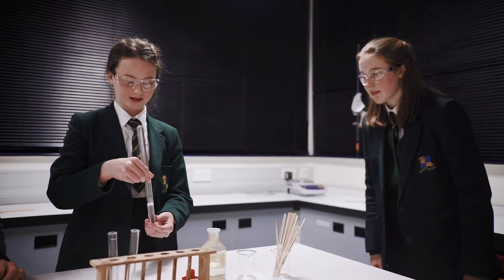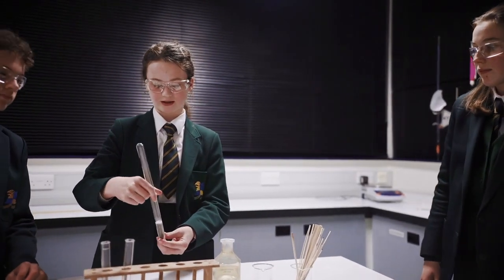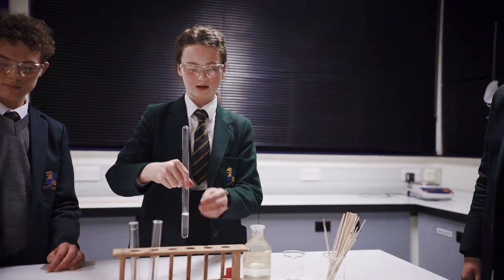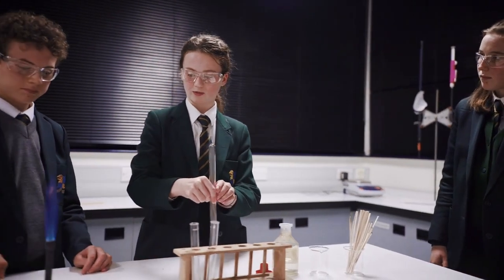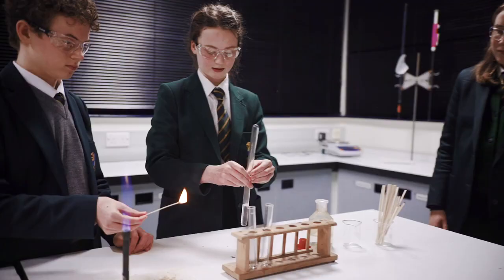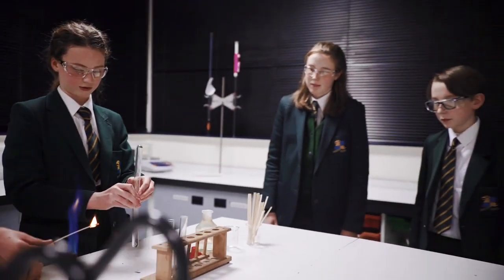We've got some hydrochloric acid and we've put in a magnesium ribbon and it's just fizzing and it will eventually disappear. The gas from that is rising to the top and it will be collected. Then we're going to light a splint and then it shoots it off.